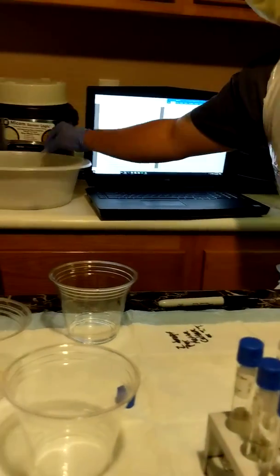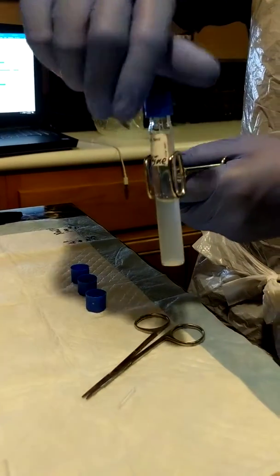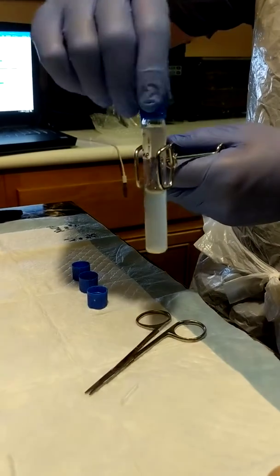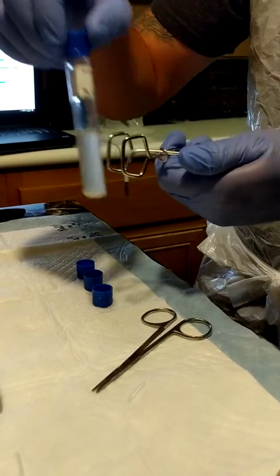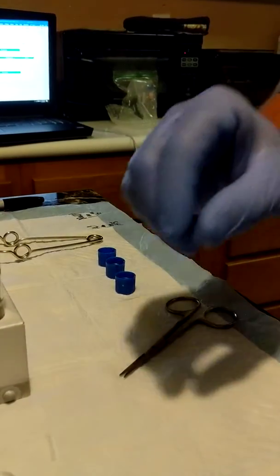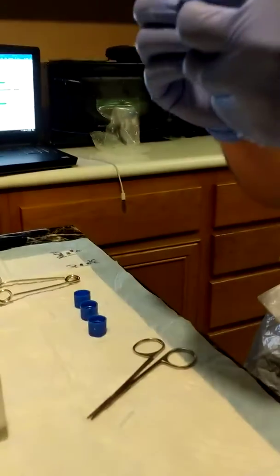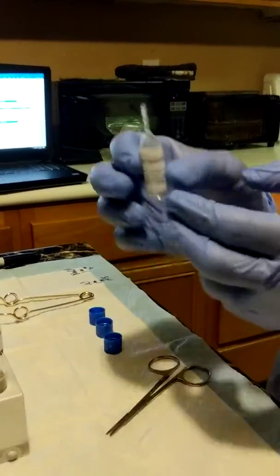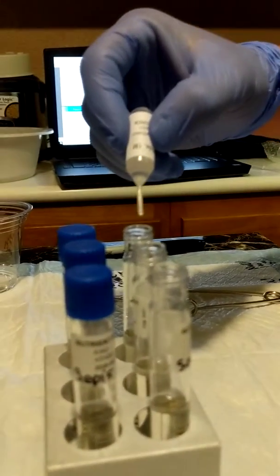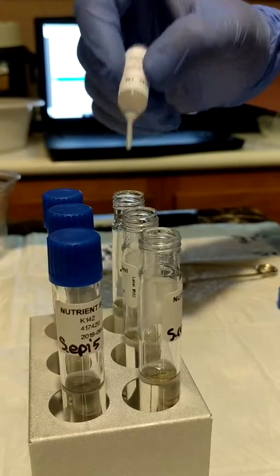Now, I have forgotten to put the sodium hydroxide and hydrochloric acid in. So hopefully this little misstep doesn't affect it too much. So we'll go to our sodium hydroxide. It's going to go in the basic pH, 1 drop.